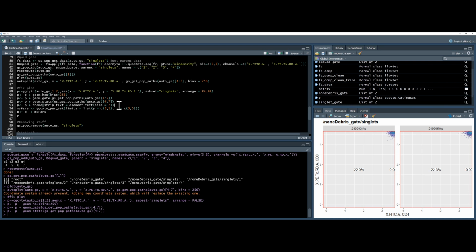I'm using this theming. Actually, I don't need the theming, I'll ignore that. This theming changes the size of this text. For previous analysis I was doing, this text didn't fit into this box, so I just made it smaller. And what I'm going to do is artificially choose my X and Y parameters. So this is going to be this myPars command using the GG Cyto par set. And my limits for the Y and X axis are 3 to 5.